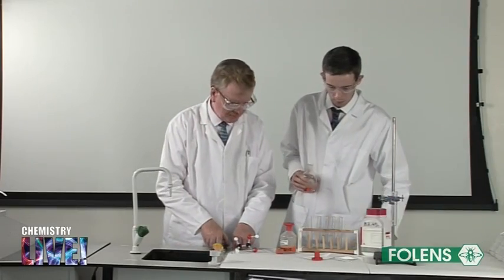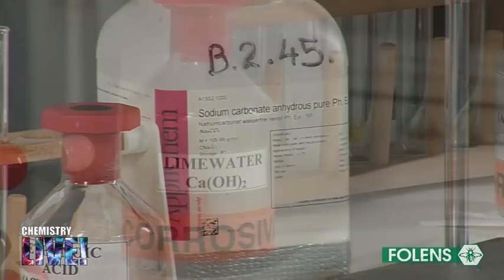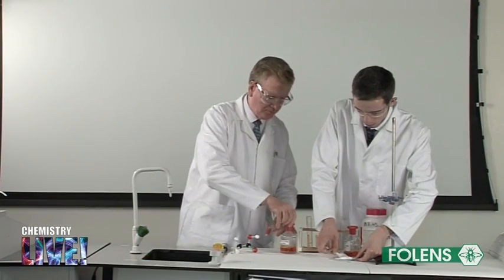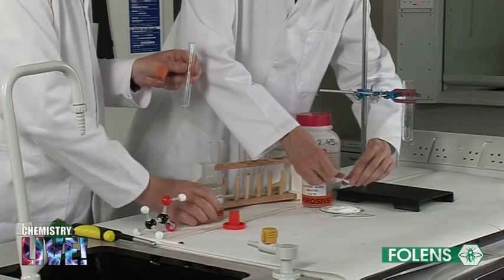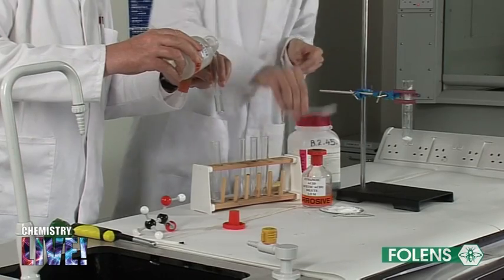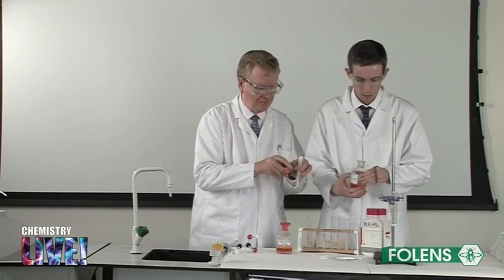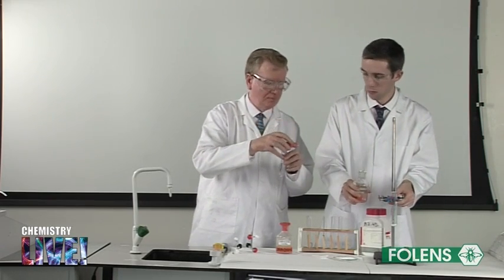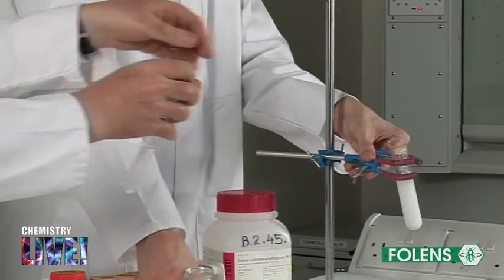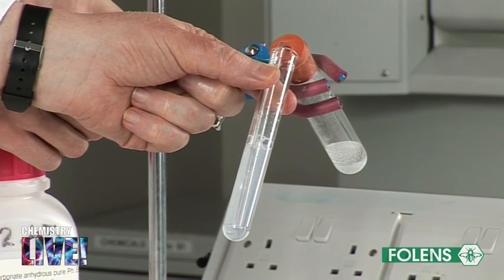This experiment is repeated by adding some ethanoic acid to sodium carbonate in a boiling tube. The gas evolved is passed through lime water solution. Note that the lime water turns a milky colour.